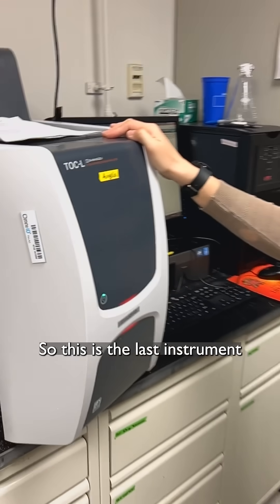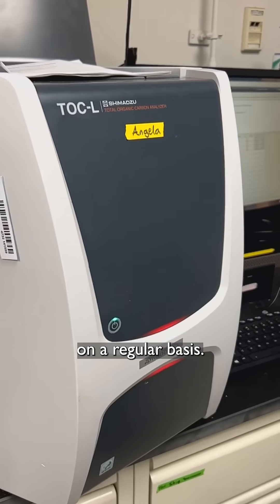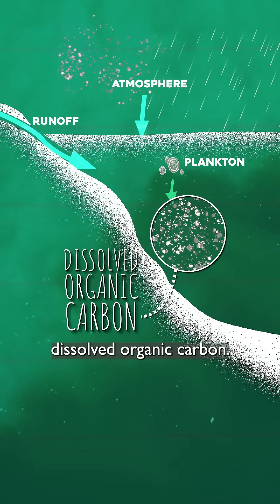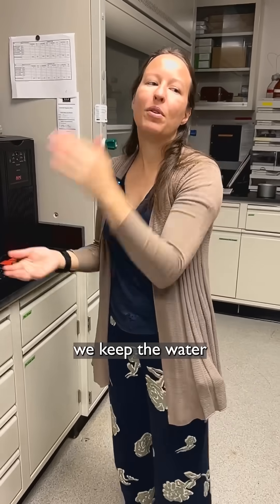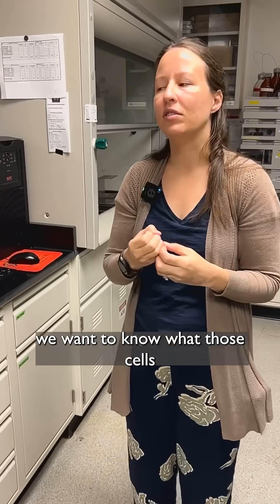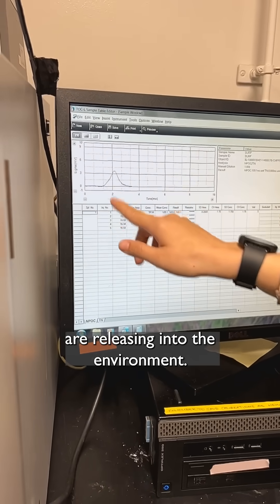This is the last instrument that I work with on a regular basis. We use it to measure dissolved organic carbon. For this one we keep the water that goes through the filter — we don't want to know what's in the particles or those cells, we want to know what those cells are releasing into the environment.